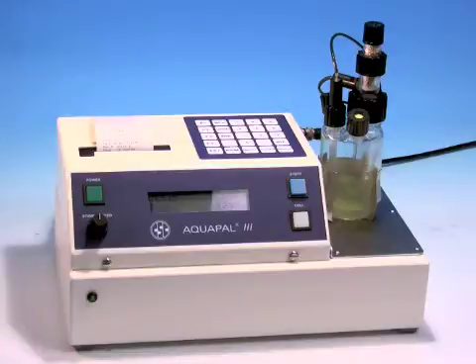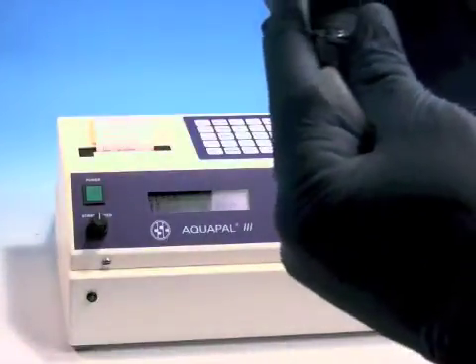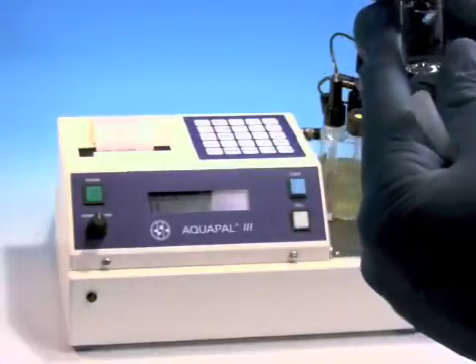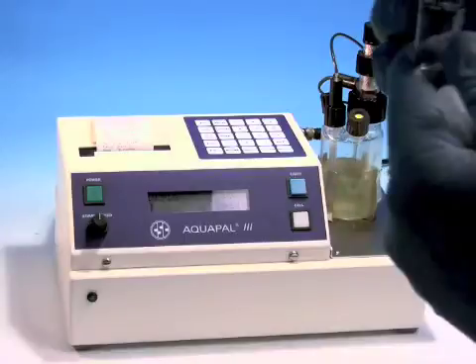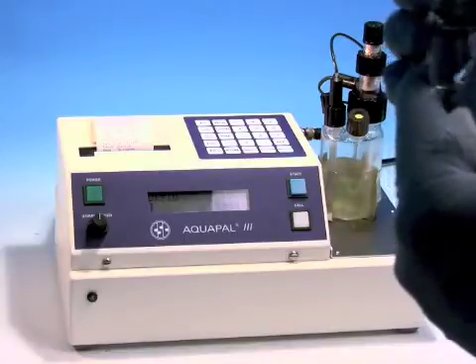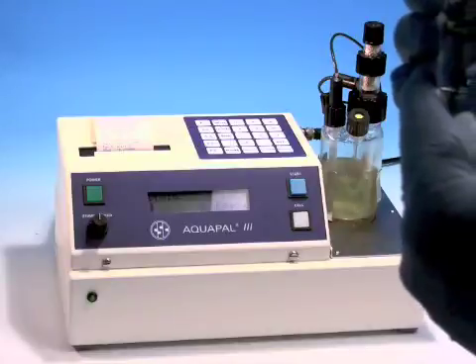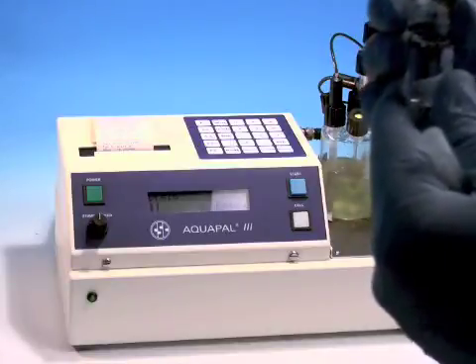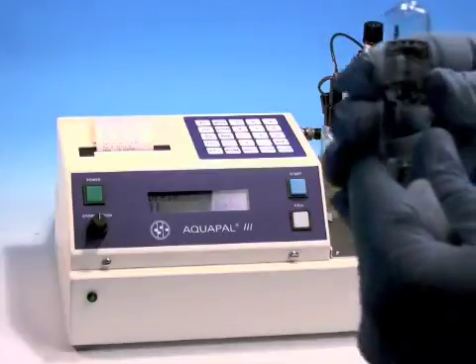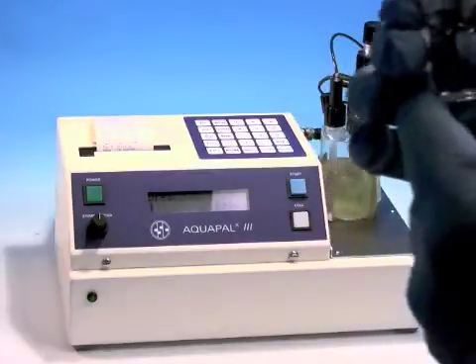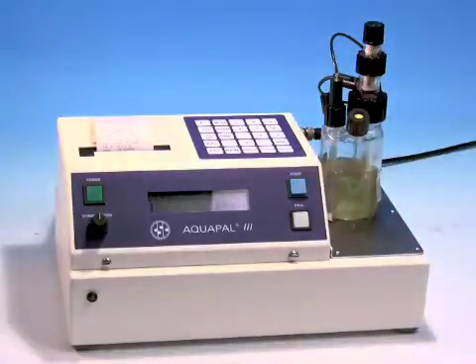What I've done is I've taken this ampoule, popped the top, and drew out 2 mls, they recommend 2 mls, and I'm using a disposable syringe and a 4-inch needle. I do prefer to use a gas-tight syringe when I'm doing water standards, but for the purposes of this test that's all I have today, so I'm going to run it with a disposable syringe. I pulled about 2 mls into the syringe and it's on the scale right now.